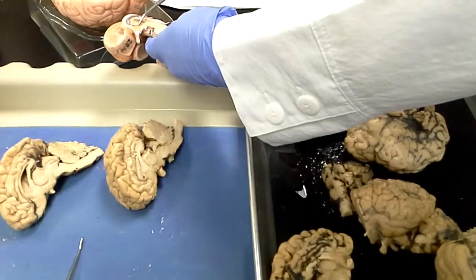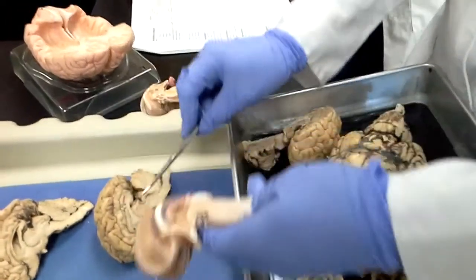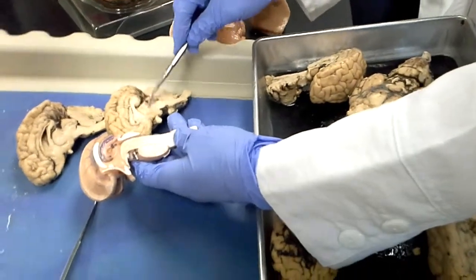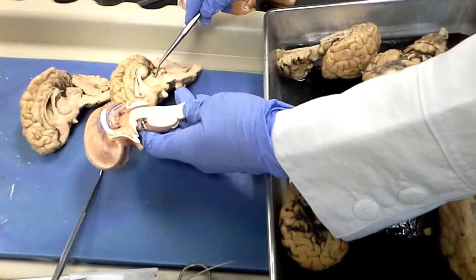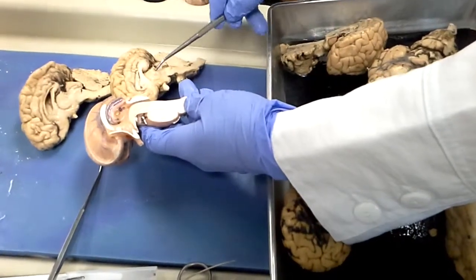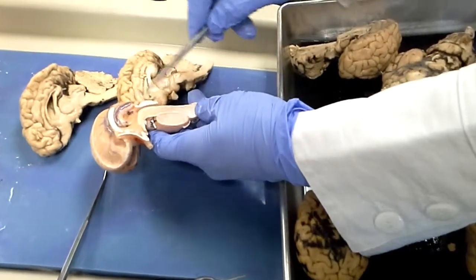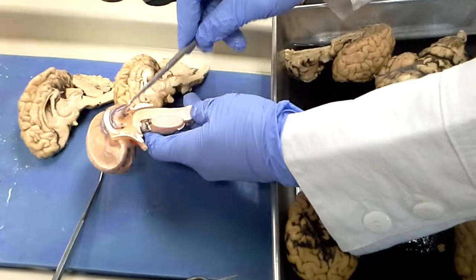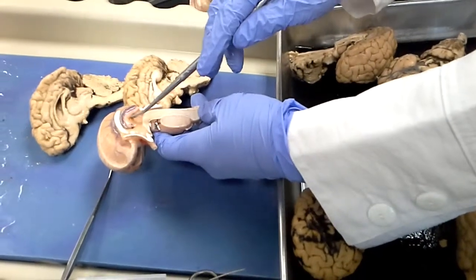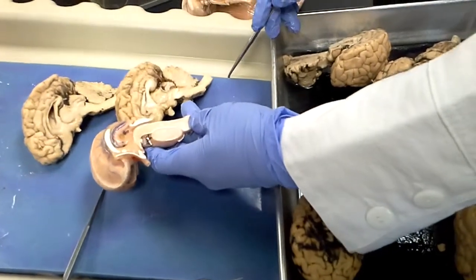The tissue around, the main portion of the diencephalon, all that tissue here, all this tissue here, that is the thalamus. In the middle of the thalamus, and it depends on the cut if we can get a good one, but there's a little bit of tissue that sticks out that would connect the right and left halves of the thalamus. That is the massa intermedia, or you could say intermediate mass. But it's right in the middle of the thalamus.